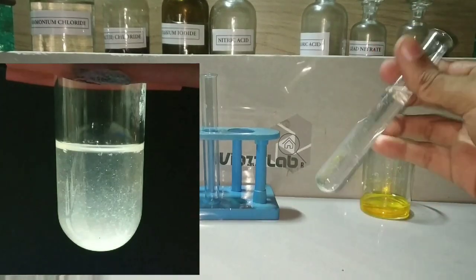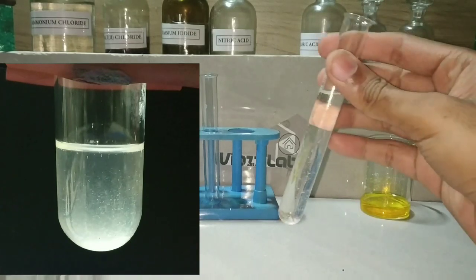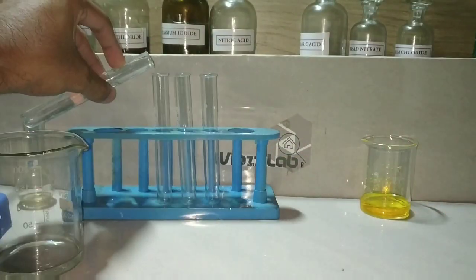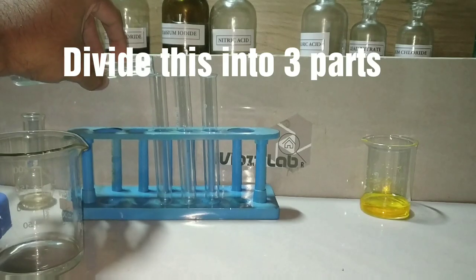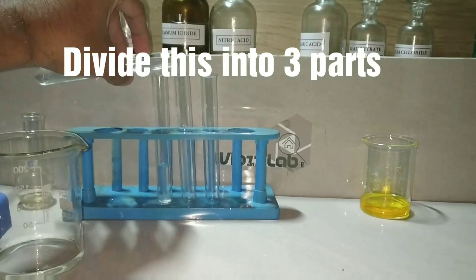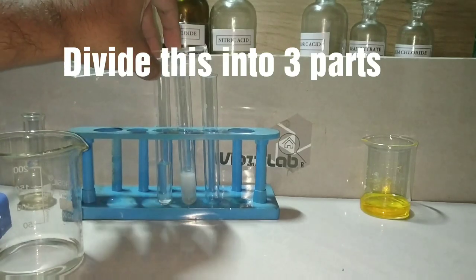We will now divide this clear solution into three parts so that we can perform the confirmatory test for each of the three cations present in Group 5.